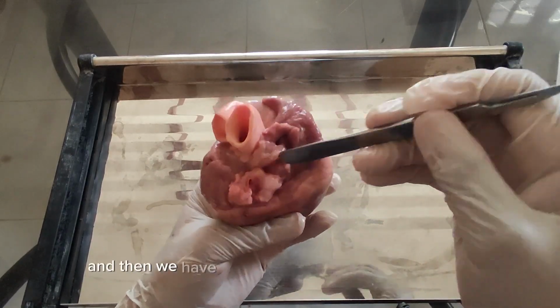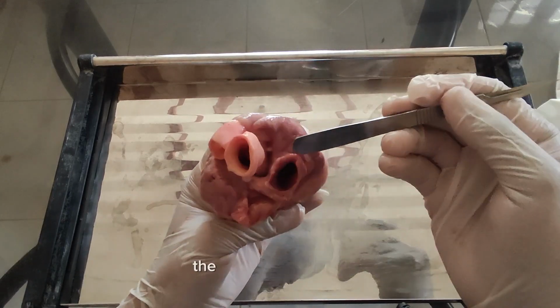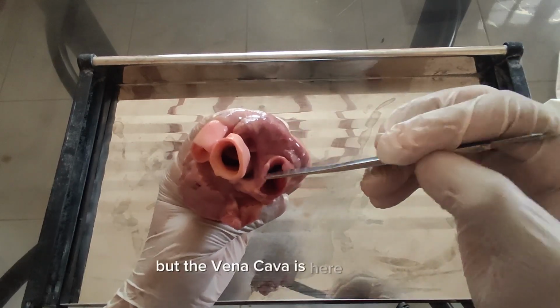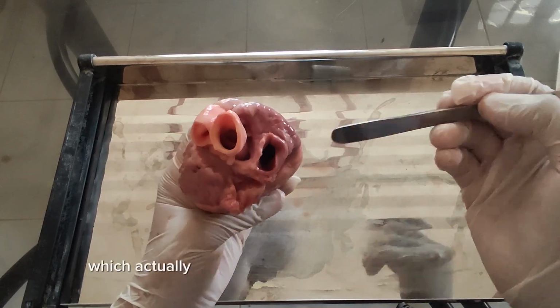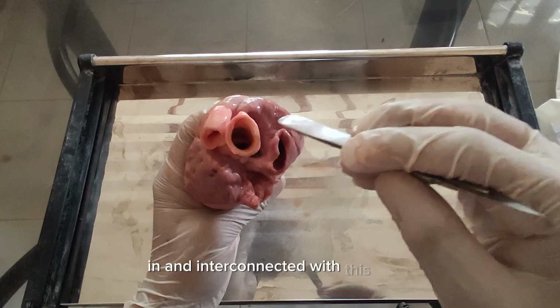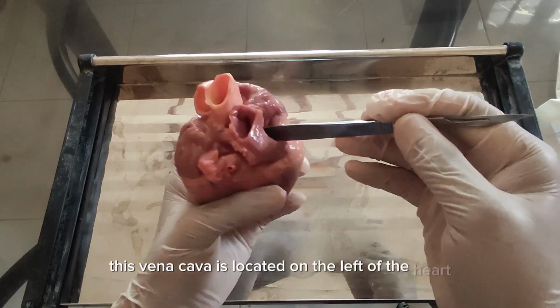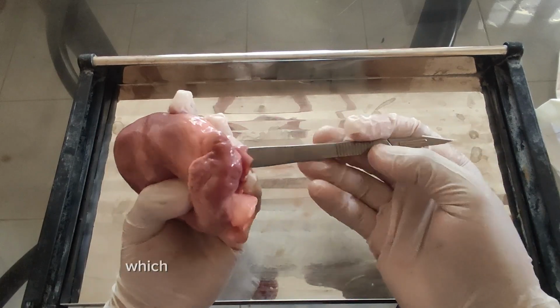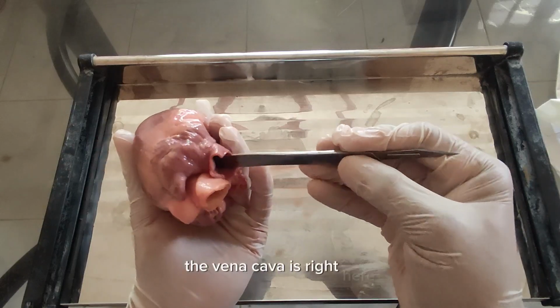And then we have the superior and inferior vena cava. With this heart, the superior and inferior vena cava are not actually visible anymore, but the vena cava is here. This is the vena cava, which has two blood vessels interconnected with this valve. This vena cava is located on the left of the heart and connected to the right atrium. This is our vena cava, which connects to our right atrium. This is the right atrium. The vena cava is right here.